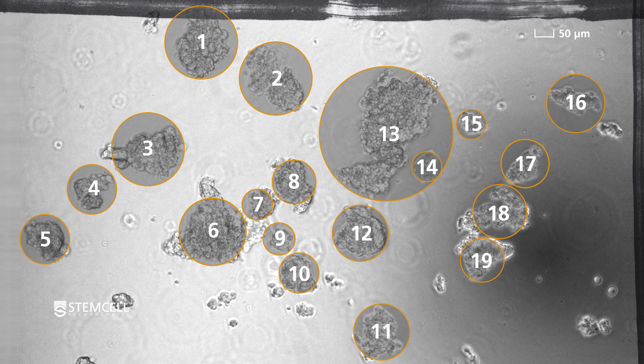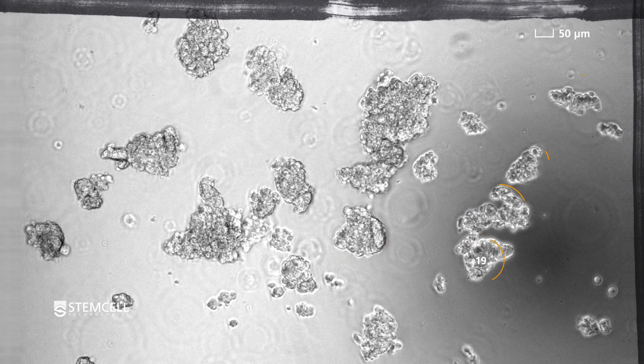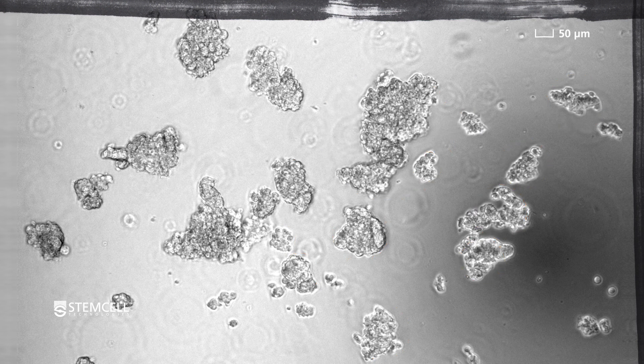Average the results from the three wells to obtain the average number of cell aggregates in the 5 microliter sample. Here, we will assume an average of 80 aggregates per well.